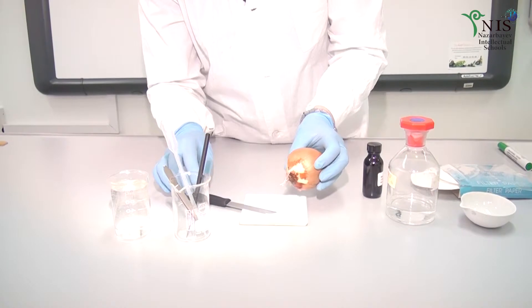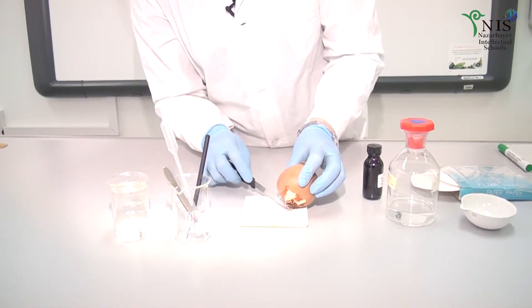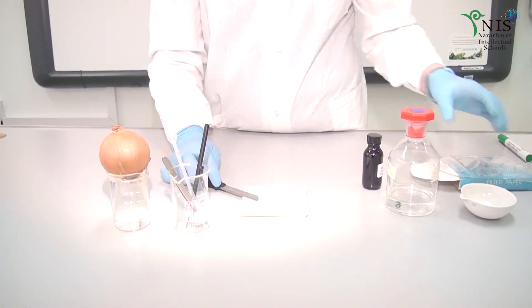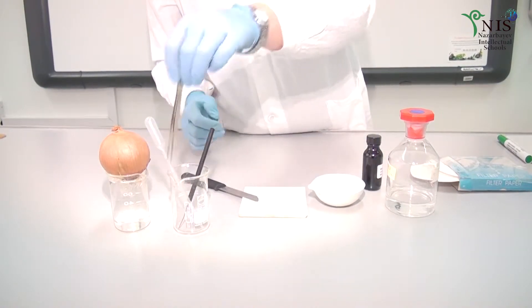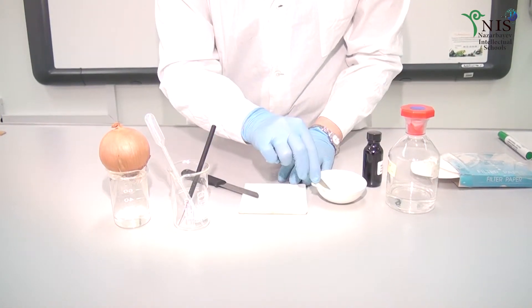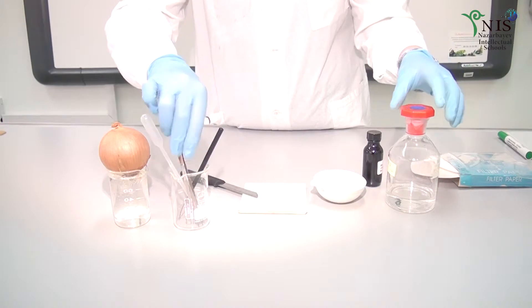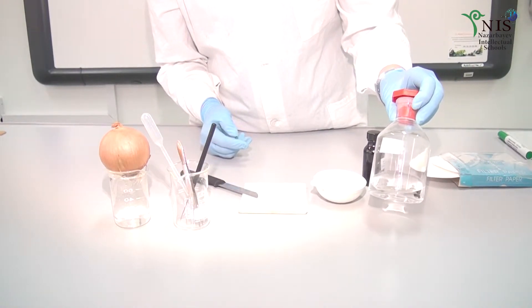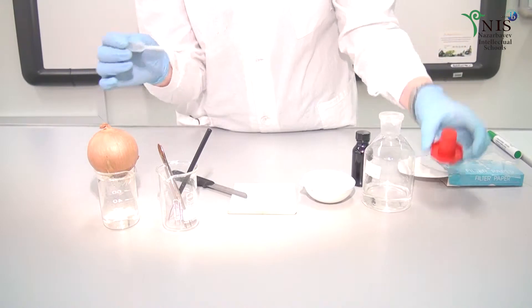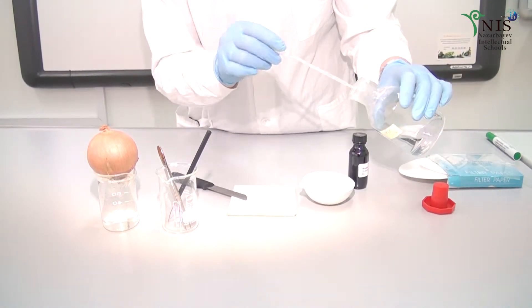Now we will observe a short video about the steps of this work, then discuss together. We take onion with roots, take some of them, and cut them. We will take 1 mL solution of hydrochloric acid to destroy cell walls. Don't forget about the safety precautions.